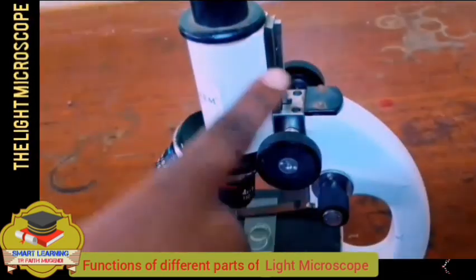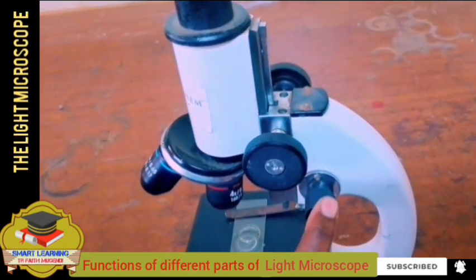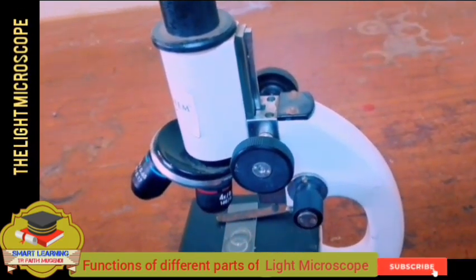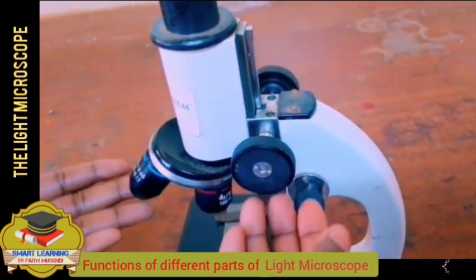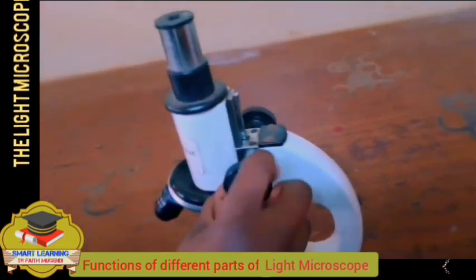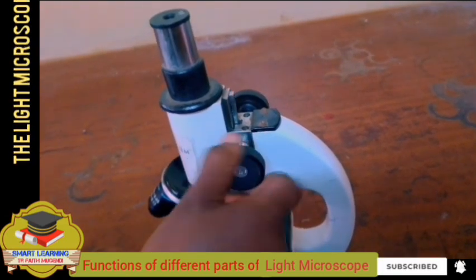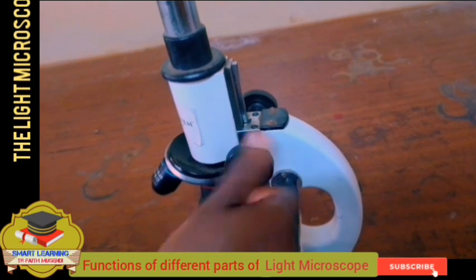Now let's look at the coarse adjustment knob and the fine adjustment knob. These are usually used to focus the image, and they can be used to move the body tube up and down. If you look, the body tube can go down and up when we use the coarse adjustment knob.